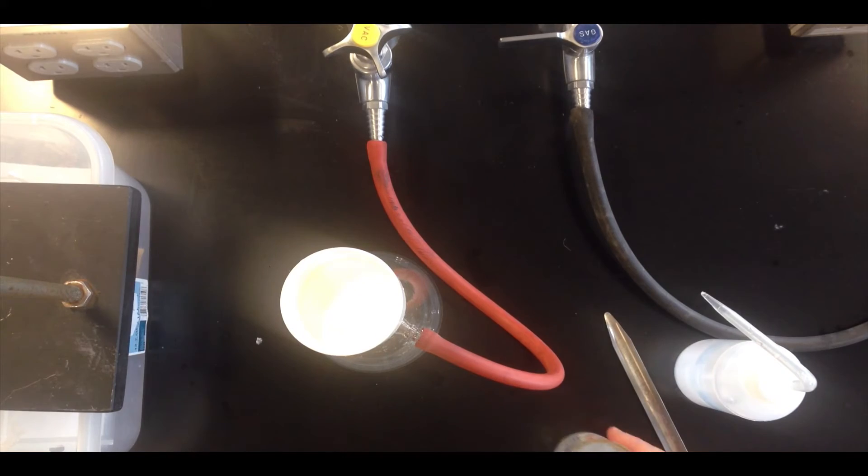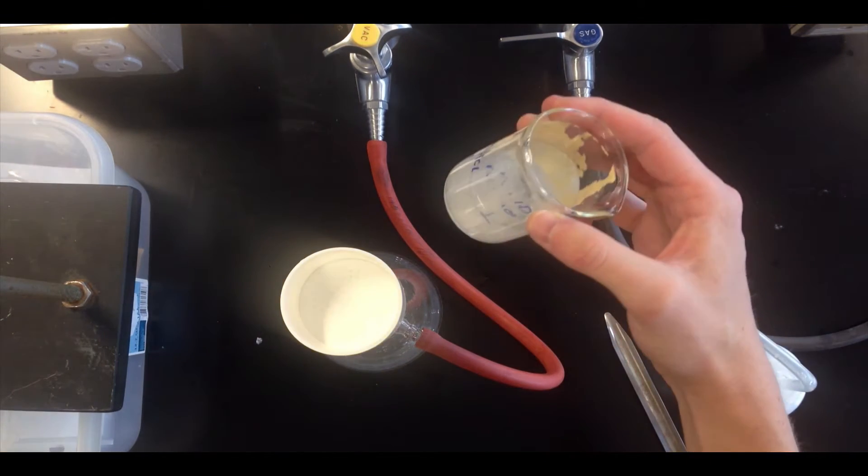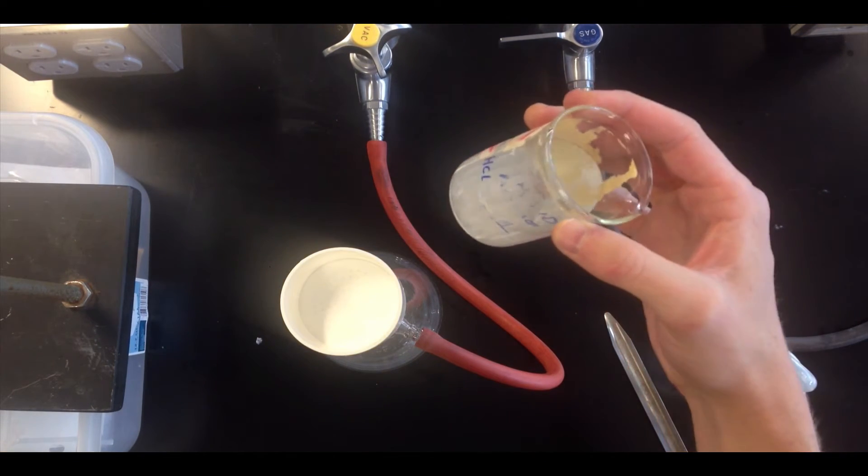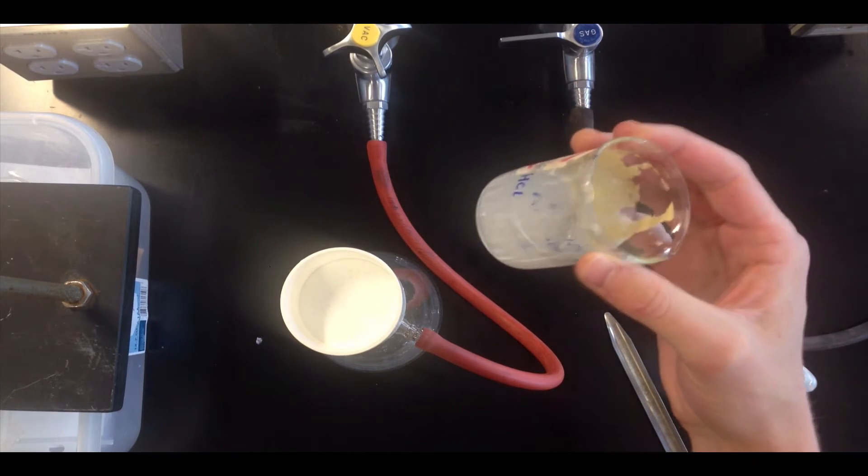So the vacuum is now running, and I have a heterogeneous mixture here of alum crystals and water, such as we might see after a recrystallization of alum, for example.